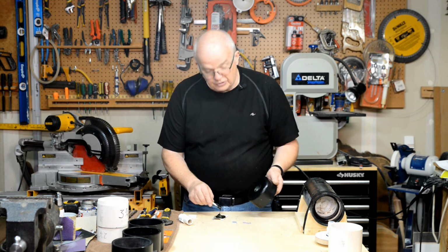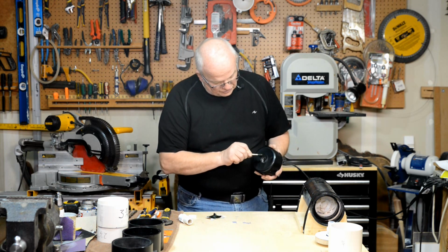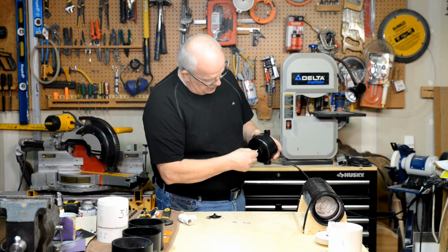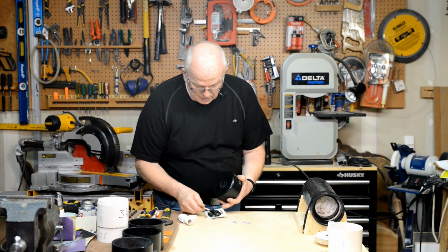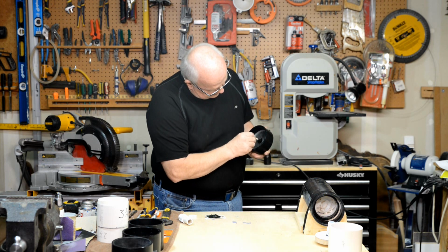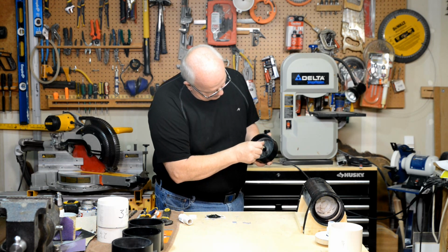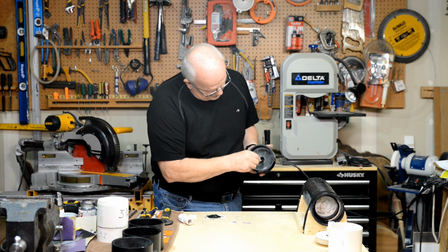And what we're going to do is the same thing as before. You take a generous amount of that, and we're going to put it right on the inside of this unit right here. We're going to want to make sure that it completely coats the inside. We're going to need a little more. I'm going to come in from this side. Make sure that it completely coats that acrylic, because that's the important part. Okay.